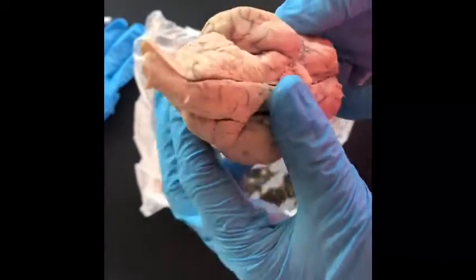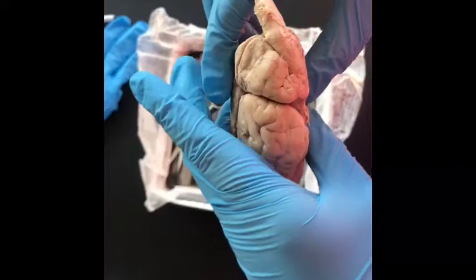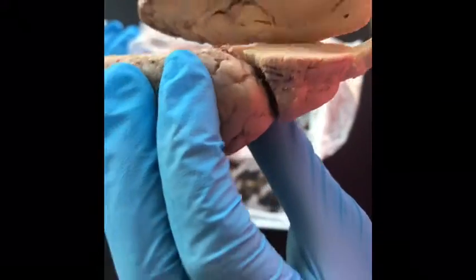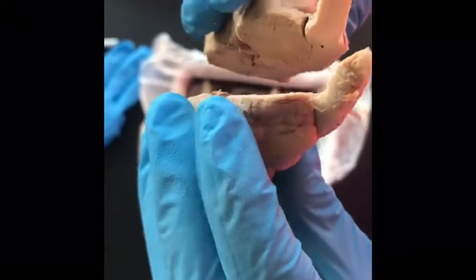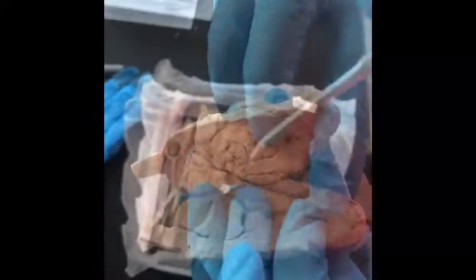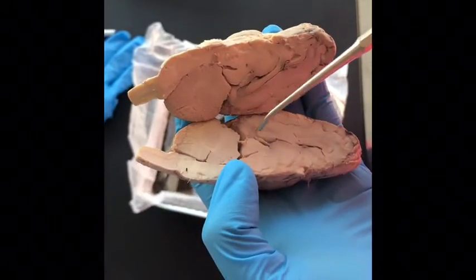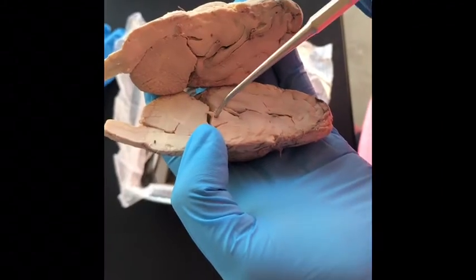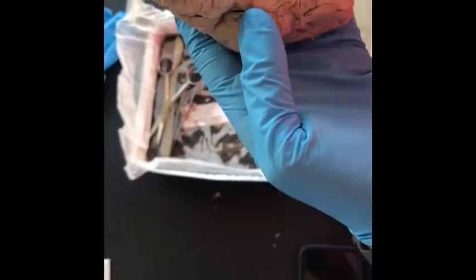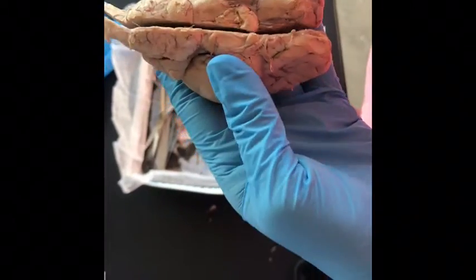The corpus callosum is to integrate motor, sensory, and cognitive performances between the cerebral cortex on one side of the brain to the same region on the other side. The olfactory bulb is a structure located in the forebrain of vertebrates that receives neural input about odors detected by the cells in the nasal cavity.